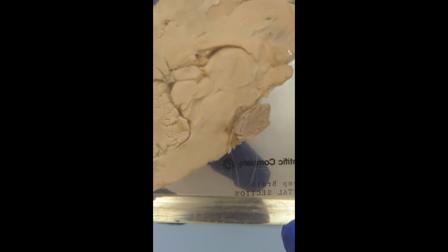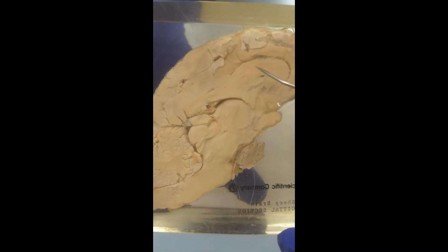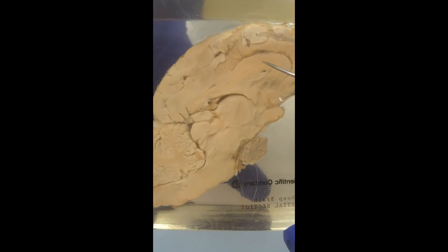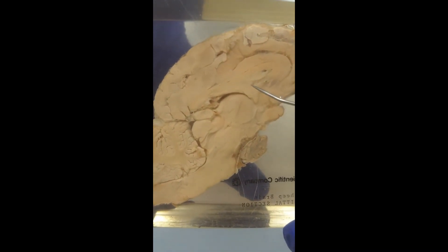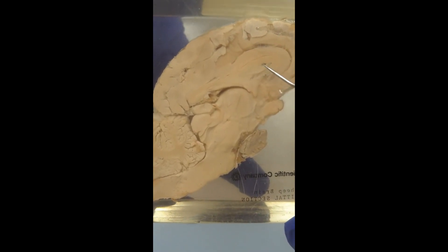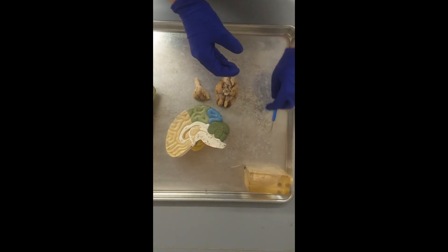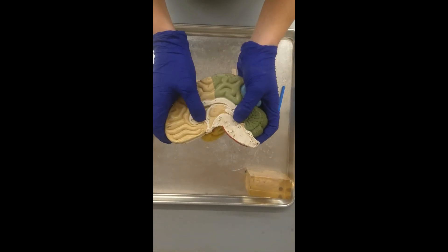You can see the corpus callosum on the sheep brain model — it's in acrylic so I'm not actually touching the brain. Here's the corpus callosum, here's the fornix, and there's this little membrane right here — that's the septum pellucidum. It's separating the anterior part of the lateral ventricle, which is what the septum pellucidum does.